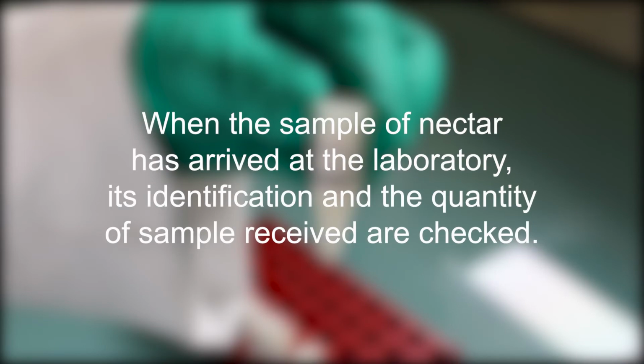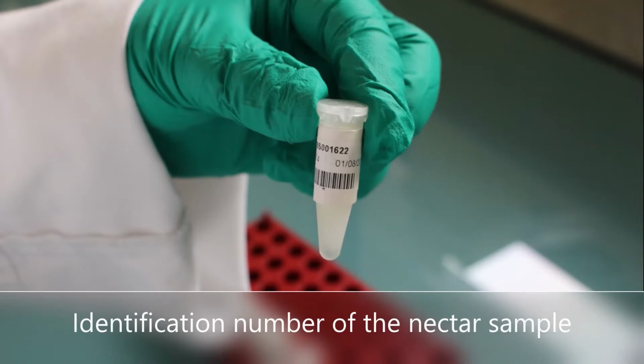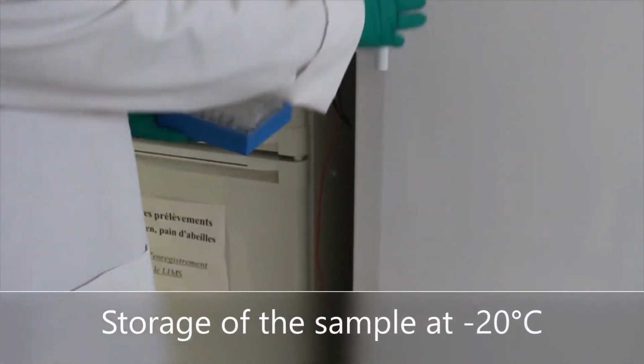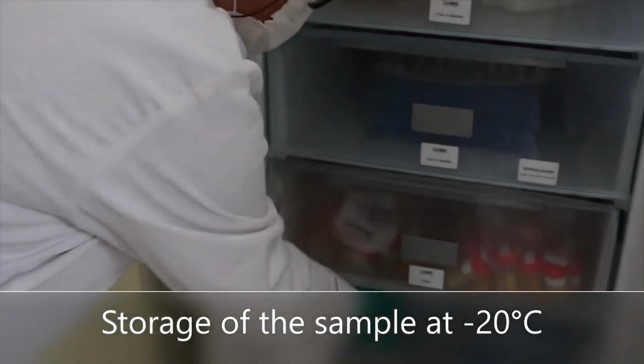When the sample of nectar arrives at the lab, its identification and the quantity of sample received is checked. Then, the sample of nectar is registered in order to have a unique identification number. And the sample is then stored in the freezer at -20 degrees Celsius until analysis.